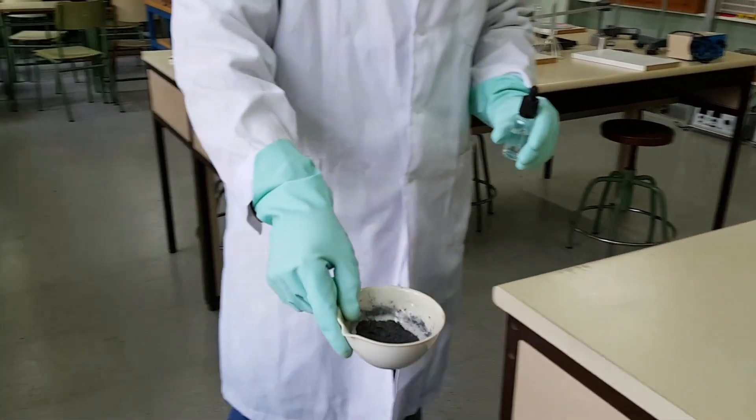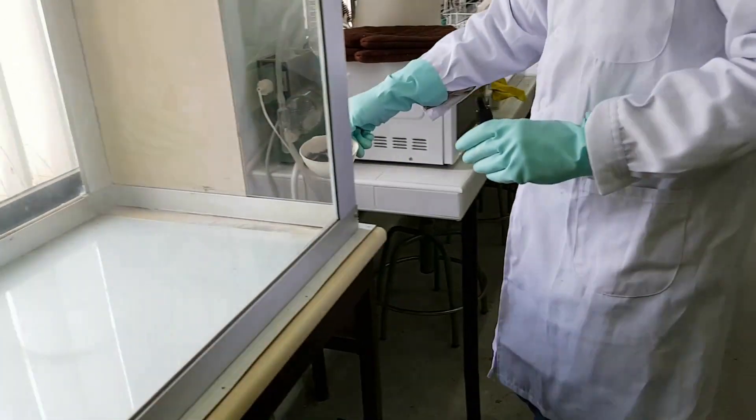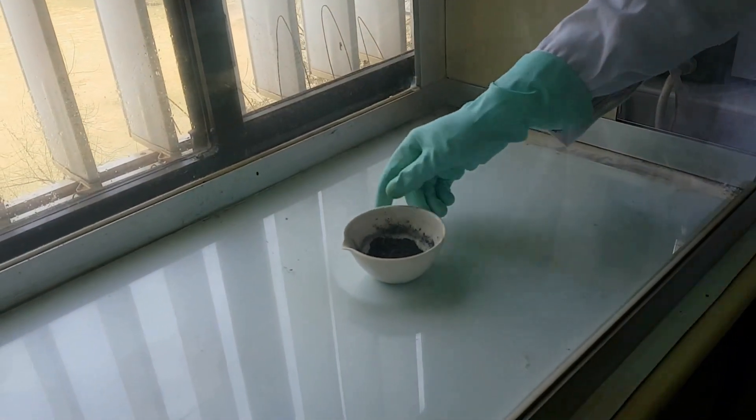Place the capsule in the fume hood. To facilitate molecular collisions, add water with a dropper. And this is what happens.